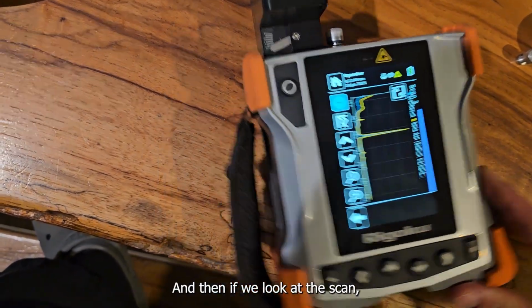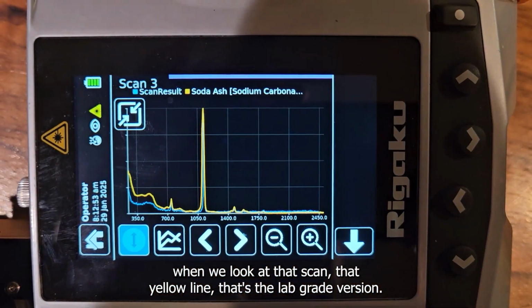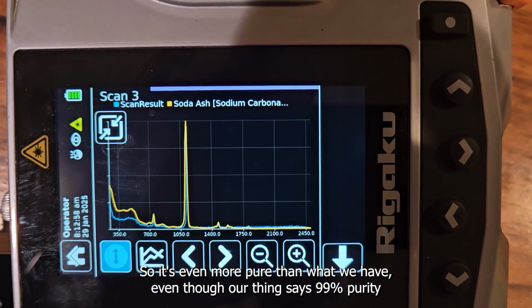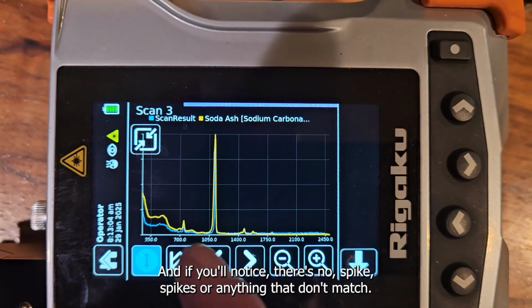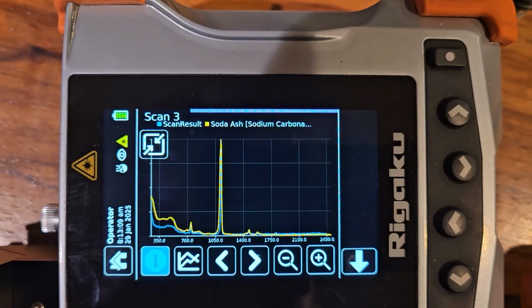And then if we look at the scan, that yellow line, that's the lab grade version. So it's even more pure than what we have, even though our thing says 99% purity. And the blue scan that's behind it, that's what we actually ran. And if you'll notice, there's no spikes or anything that don't match. And that's really what it's going for.